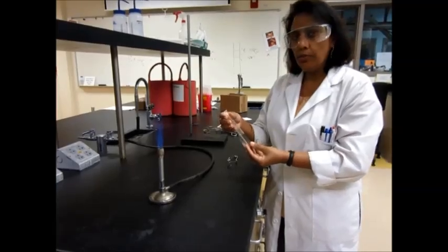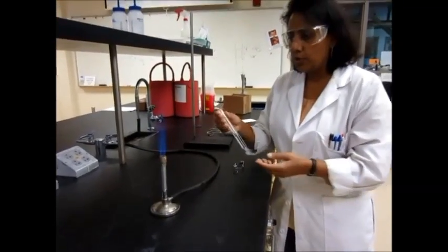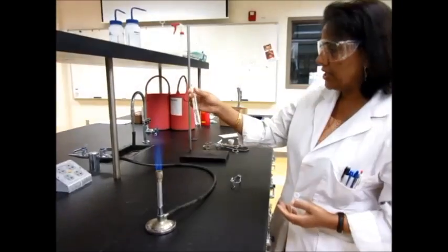When you want to heat a test tube with the contents inside, which you may have to do in a lab or two, get your test tube.